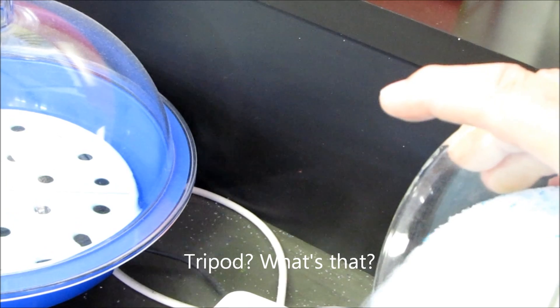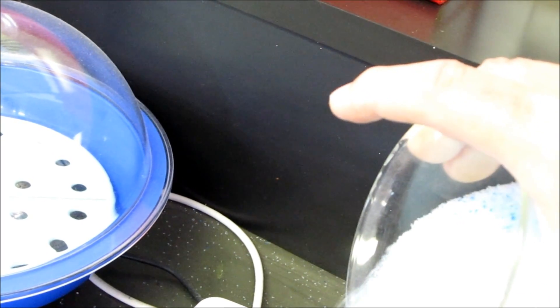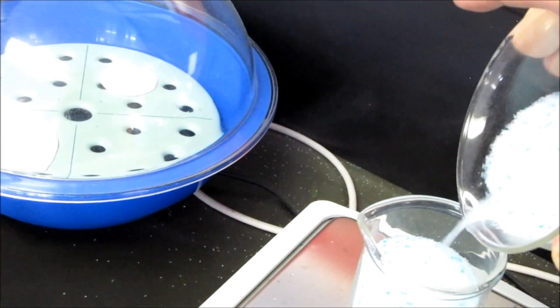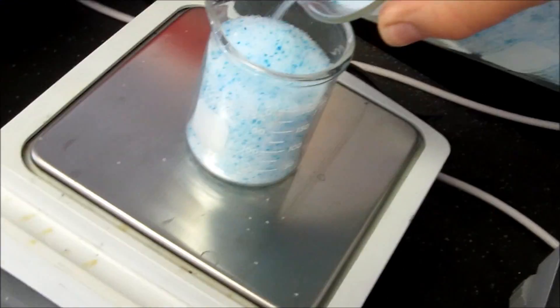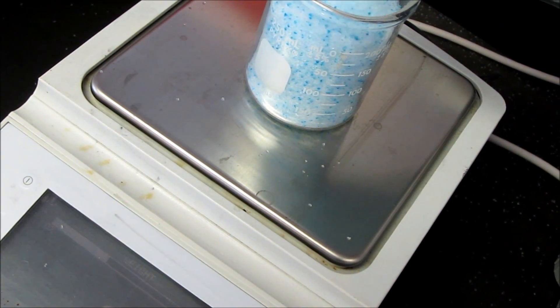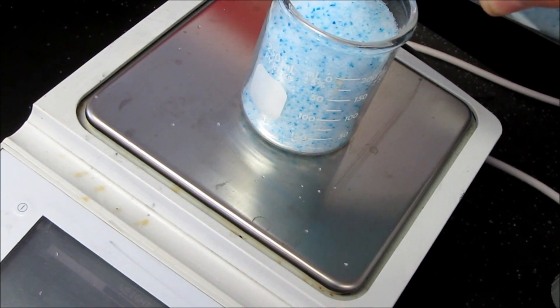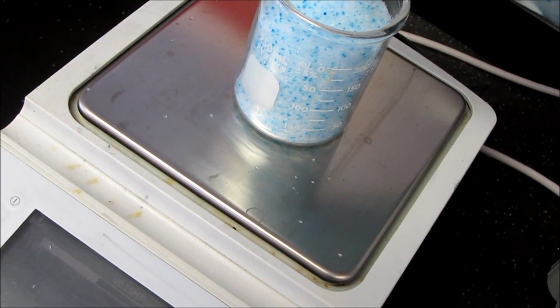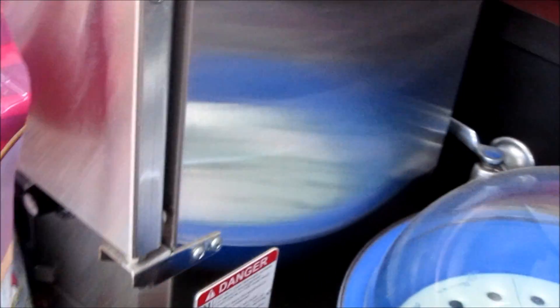So because my scale is limited in its range, I've got to do about 100 grams at a time. Getting there, and a skosh more. I'll do that until I have 516 grams.